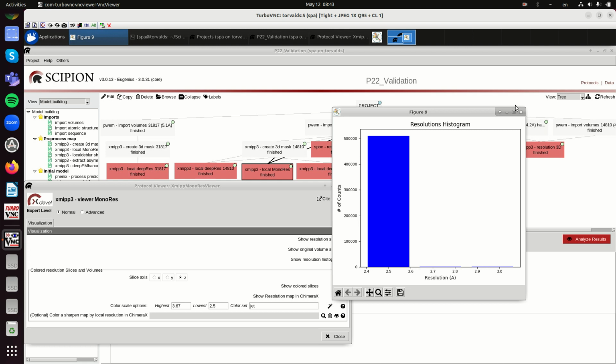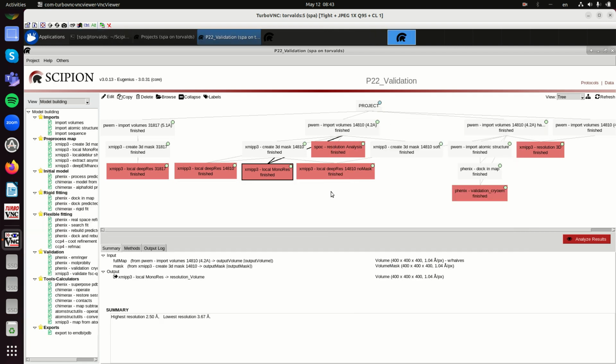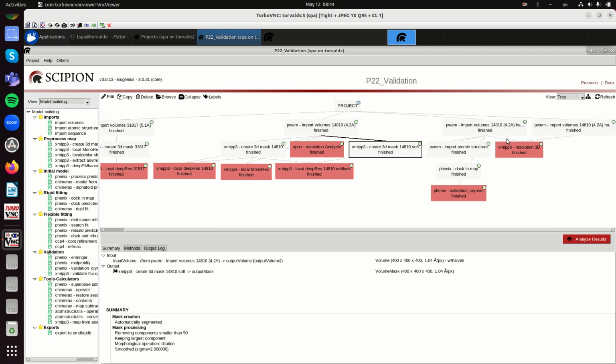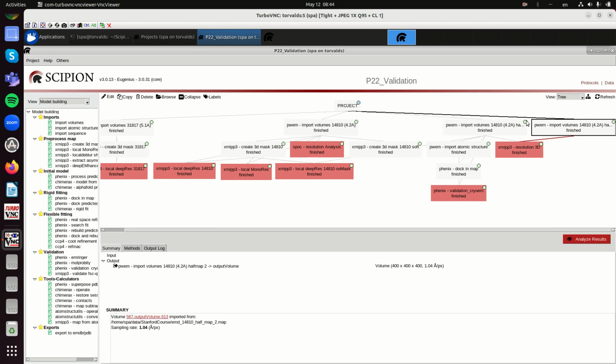So actually this one is almost reaching Nyquist, but it is because of the mask. Okay, so now let us import the two halves. Even if they are halves, if you combine them, you will get a better reconstruction, but this better reconstruction is not so much better than the original two halves. You reduce the power of the noise by a factor of 2, which is an important factor, but it is not a factor of 10, or a factor of 100.